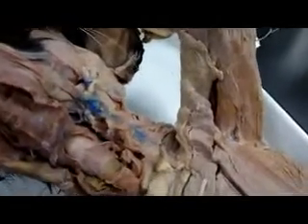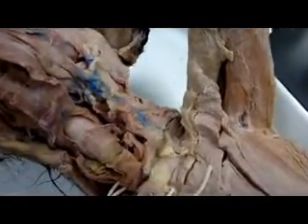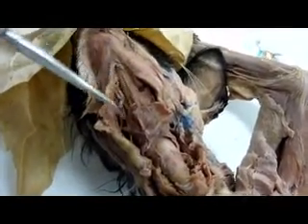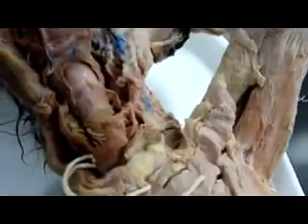Mylohyoid would be this little thin stuff. Let's see if I can go into it right there. This is geniohyoid. Underneath, I can't do it on the left side. Genioglossus.